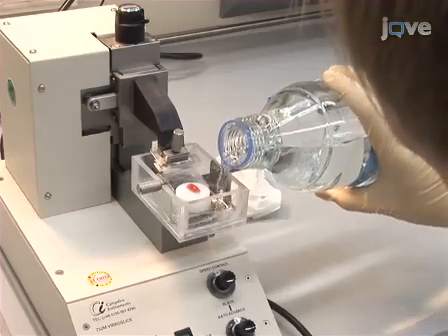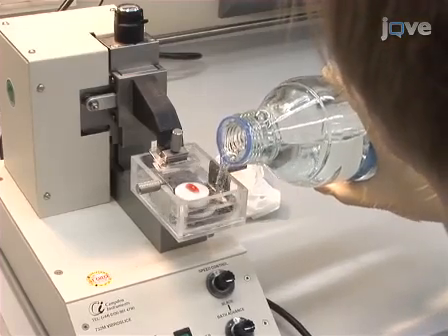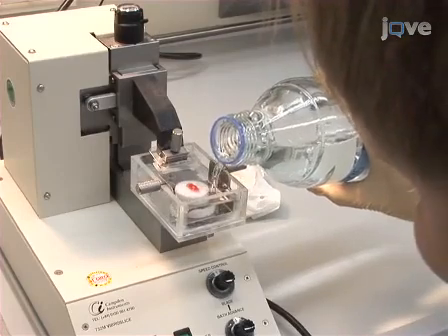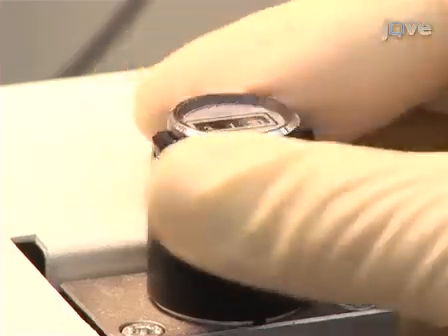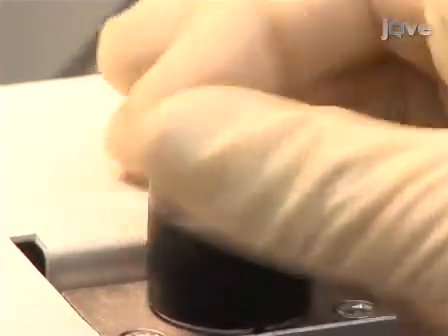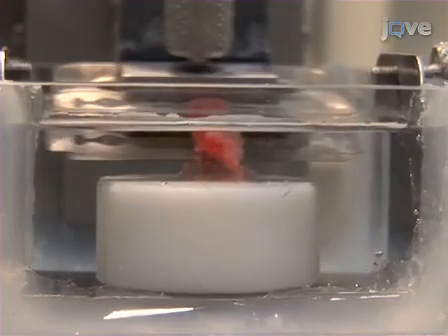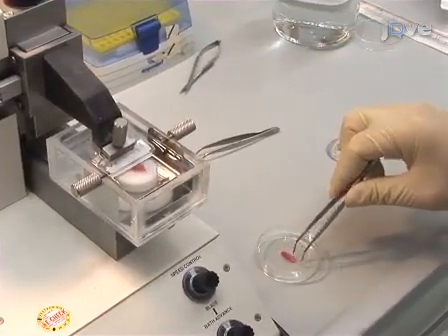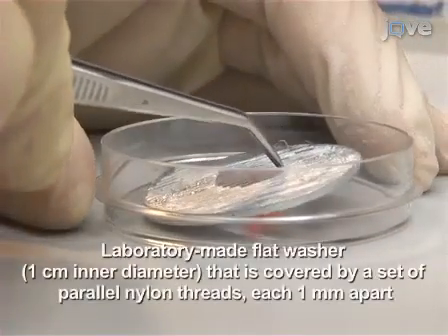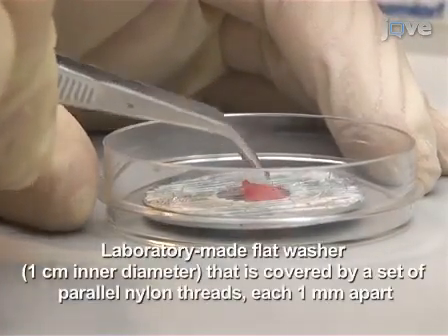Next, install the block in the cutting chamber of the vibratome and then fill the chamber with the pre-chilled PBS. Set the razor to a mid-range vibration with a medium driving setting and cut a horizontal cross-section of the lung. Then place the upper half of the sliced lung tissue upside down in a 5 cm diameter plastic petri dish. Fix the lung tissue to the petri dish by placing a flat washer on top of it.